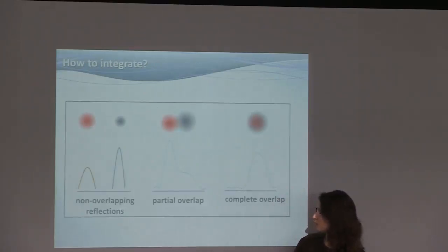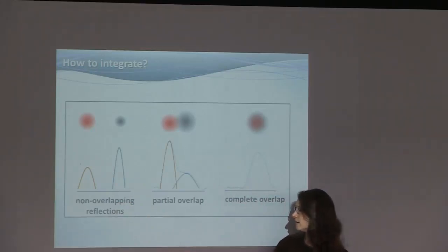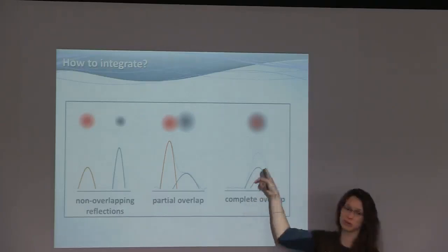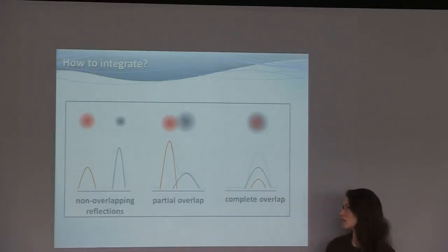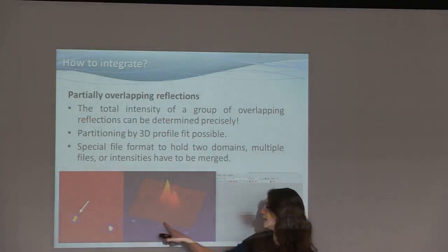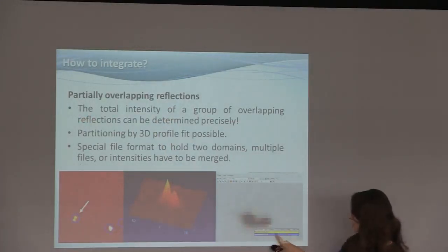So profile fitting would be something like this. We look at non-overlapping reflections. We get an idea what their profile is. Partial overlaps, we can then split up. And complete overlaps, we need to have symmetry equivalents which are not completely overlapping. Otherwise, we can't know how much of this reflection will belong to one intensity and how much to the other. It's a really difficult thing to do. Now, in reality, a partial overlap may look like this. So this is this reflection from the data set I've shown. And you can see how you could possibly split it in two different reflections. In MOSFlm, it would look like this.